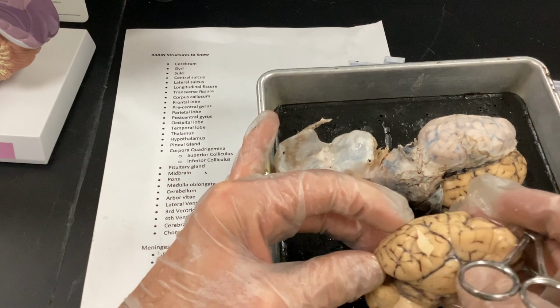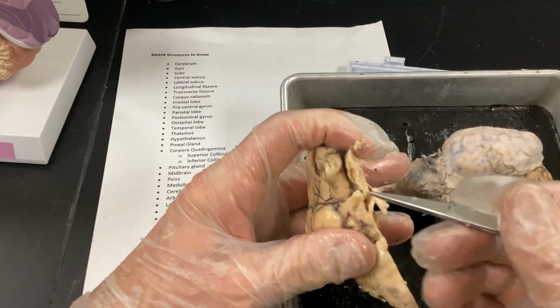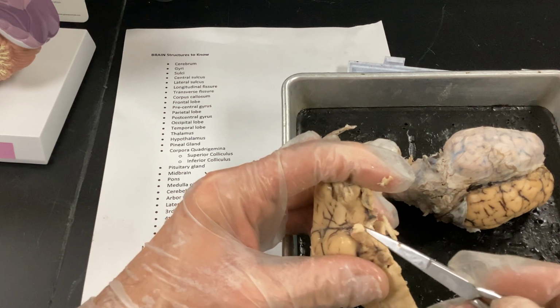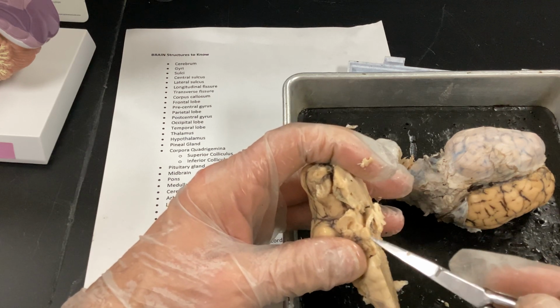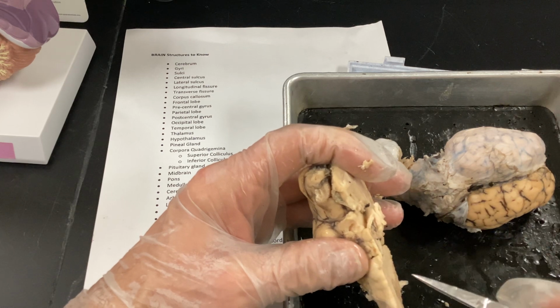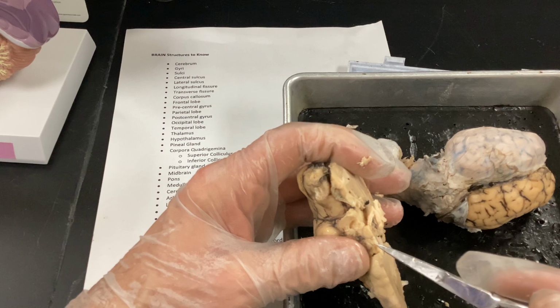So the occipital lobe here is for vision. I don't know if I have it on here. So there is cranial nerve 2, all right? When we dissected the eye, I showed you guys the cranial nerve, but cranial nerve 2 comes out, it's going to cross the optic chiasm. Remember, once again, lateral fibers stay ipsilateral, medial fibers cross over, so they go contralateral.